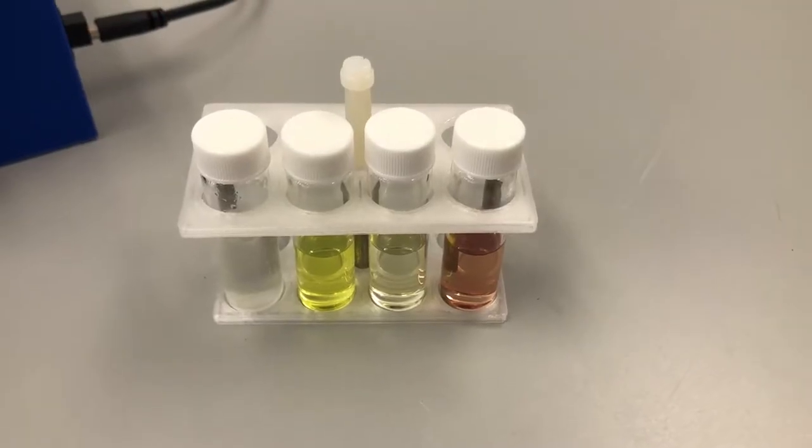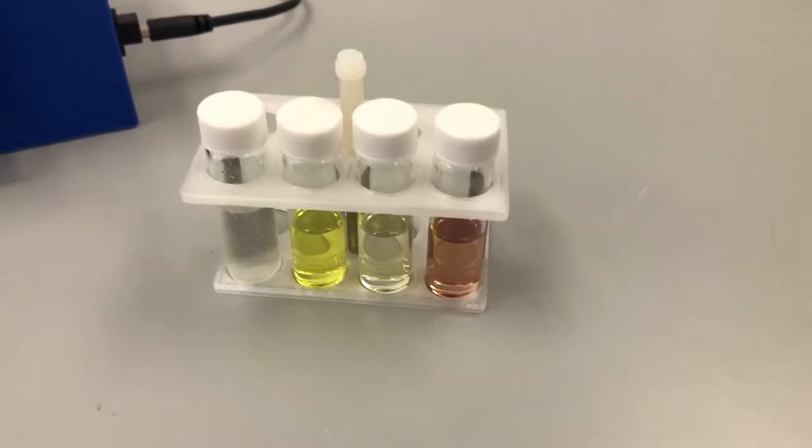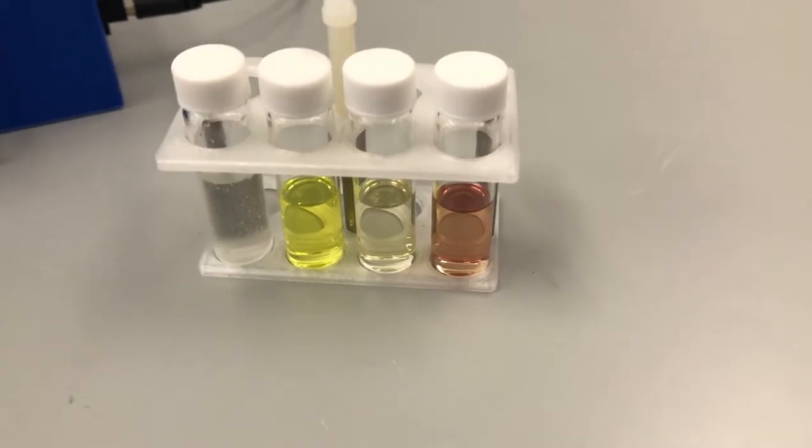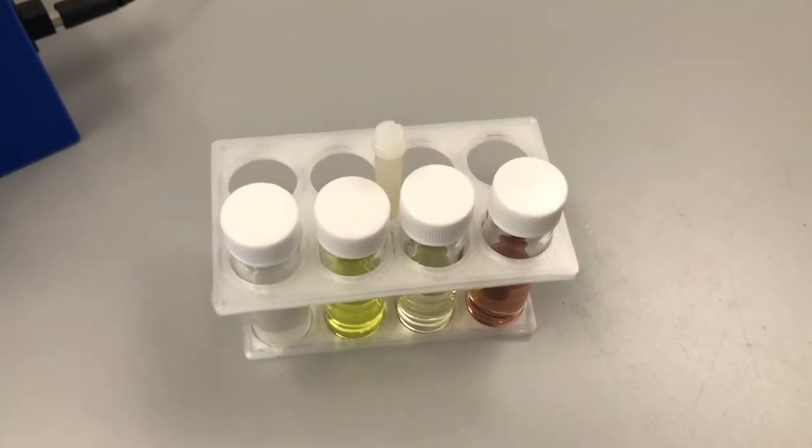We placed all the catalysts into one of our vial holders, and look, I know what you're thinking. It's pretty easy to tell which colors are going to be which, and you're right, but we're doing this for the lighting effect.